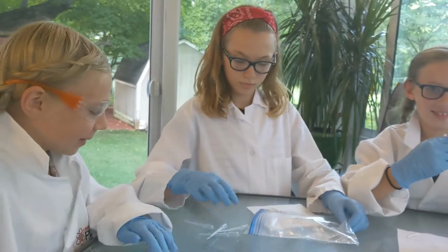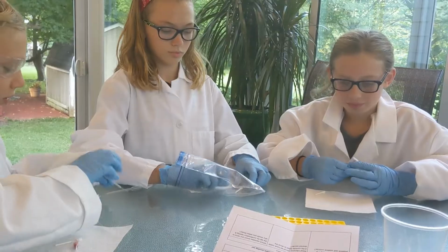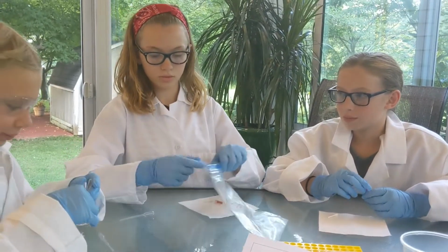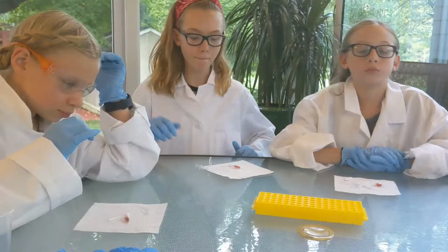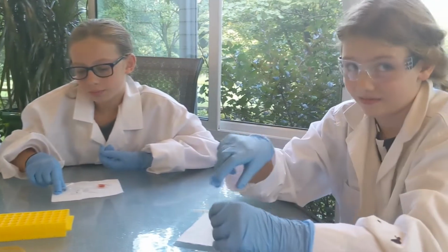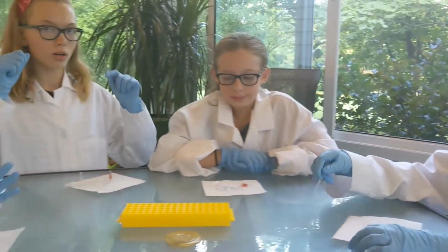Okay, now we also have the 4 chemicals. So one of you should be in charge of each chemical, I think. They don't have the letters on them though. Right. So what you could do is you guys could write the letters on them. Should we do that? Yeah. So you have each labeled your pipettes, and you have the pipette that matches your reagent in your tube, right? Yeah. Awesome.